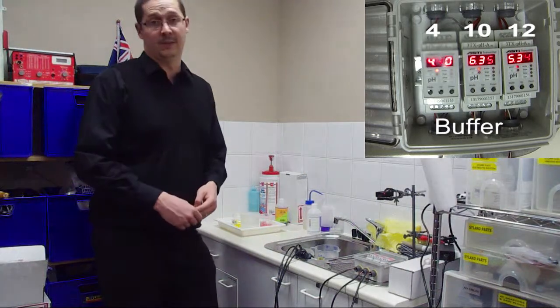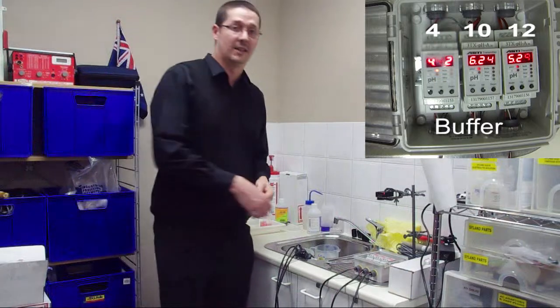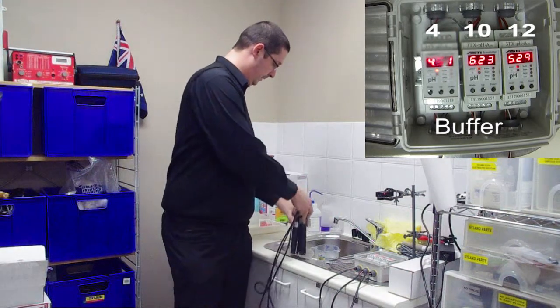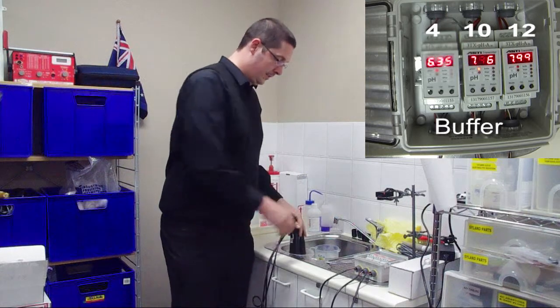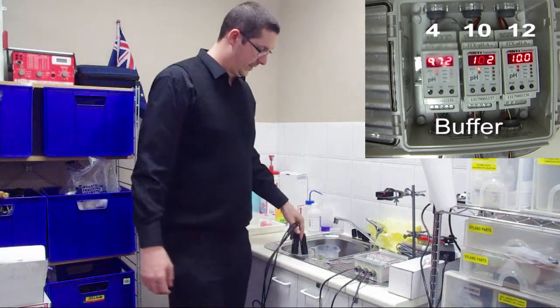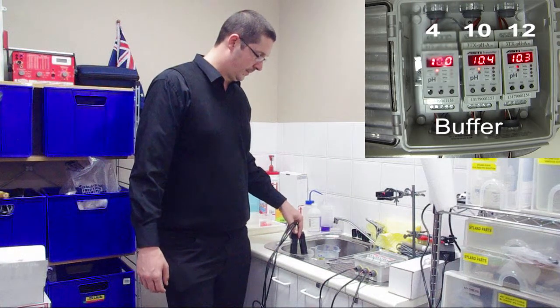So what we're going to do is put all the probes into each solution and see what numbers we get at the other side. Let's start with the basic solution. So we've got all the probes in, let's see what numbers we're going to be coming up with here.